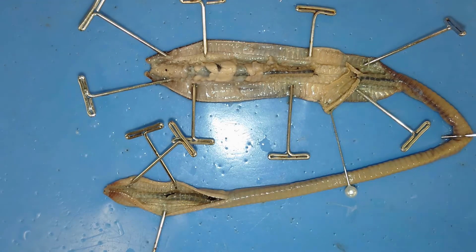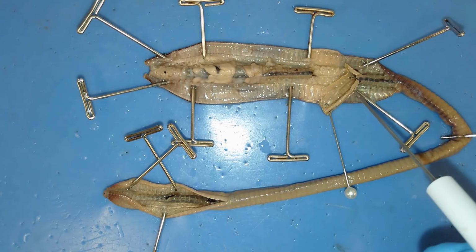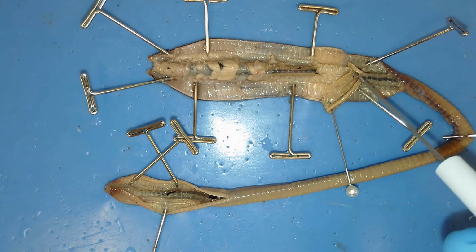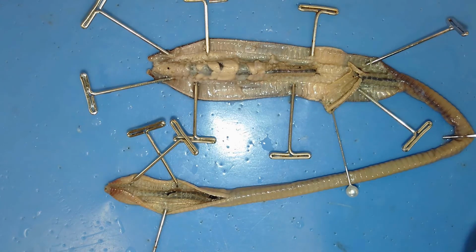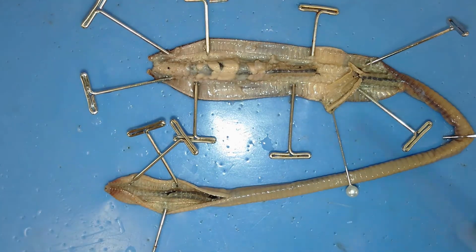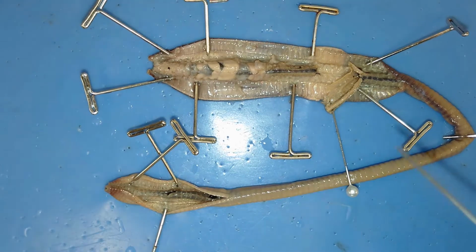So that cylinder runs the length of the body, but it has a fairly neat adaptation for increasing surface area. I've taken the liberty to open up this intestinal tract of this earthworm. So if you think about it, this was a solid tube or a cylinder running down the length of the body, and then there's this structure right here, this ridge that hangs from the very top, kind of like the tonsils in the back of our throat.